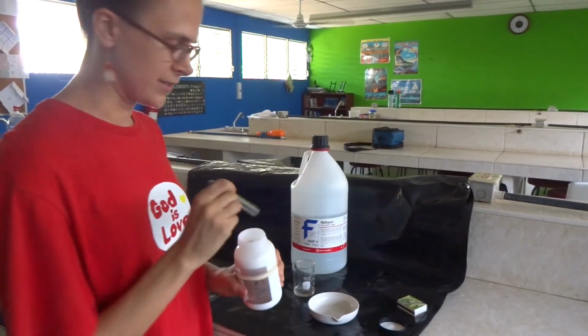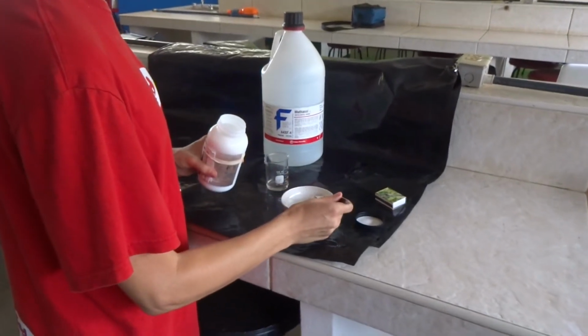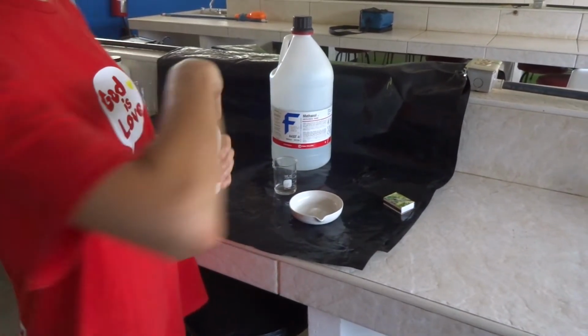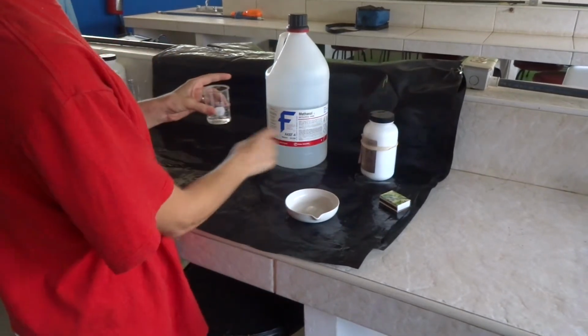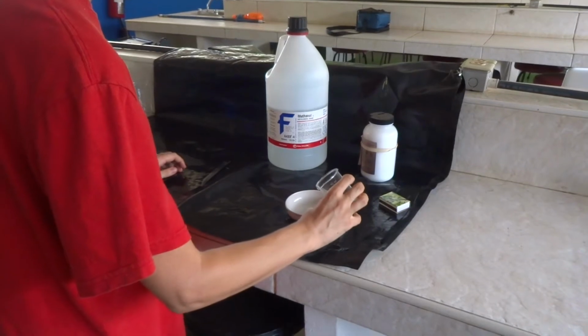That is not actually involved in the chemical reaction, it just adds a little bit of color, which makes it fun. The primary chemical reaction is going to be burning ethanol, or methanol. This is the methanol. I've already got some in a little beaker, so we are going to add a little bit here.